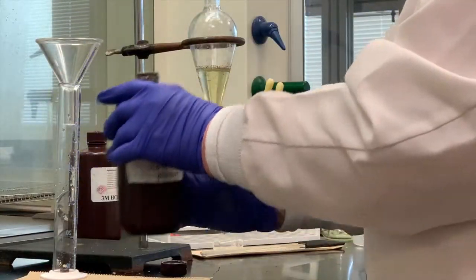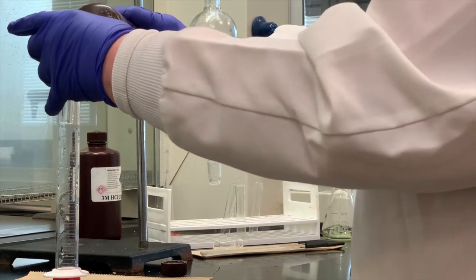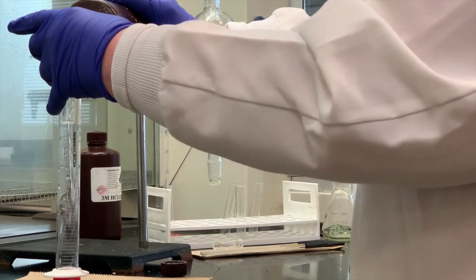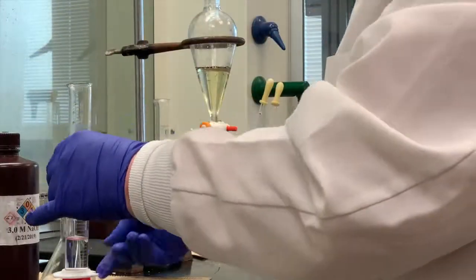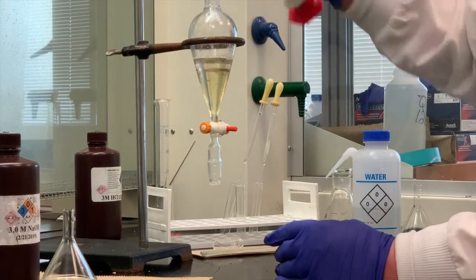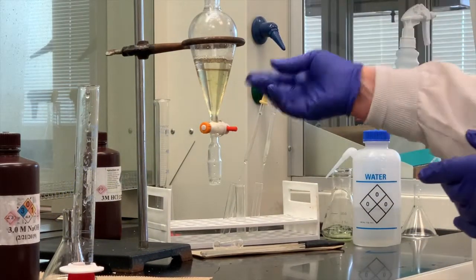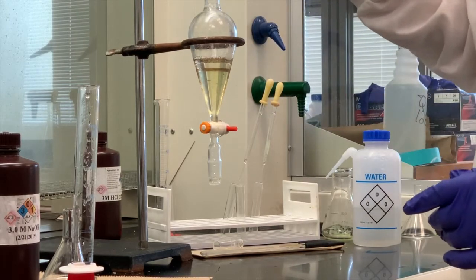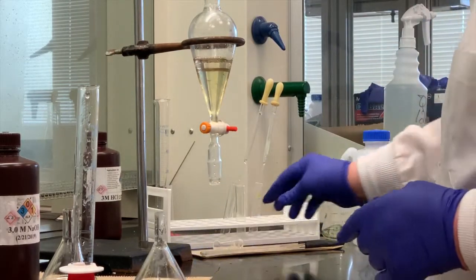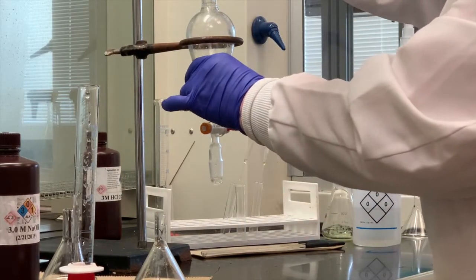With sodium hydroxide, we're probably only going to wash it twice. Previous experiments have shown that's usually sufficient. And the reason that you wash or extract more than once is that it's possible you didn't convert everything the first time, so at least doing it twice is beneficial to getting back as much as you had in that original sample.